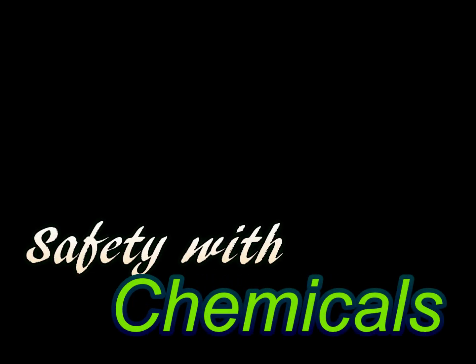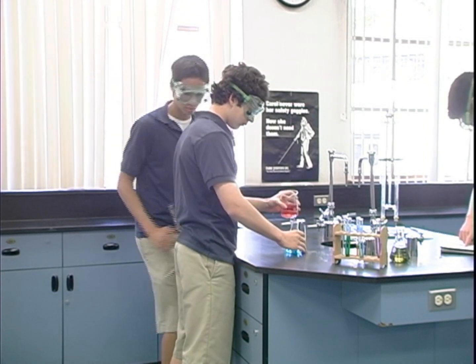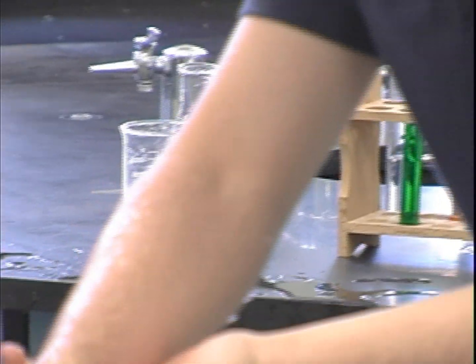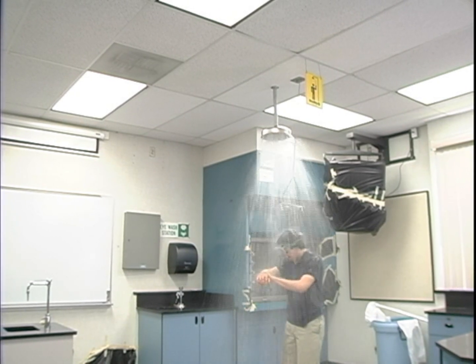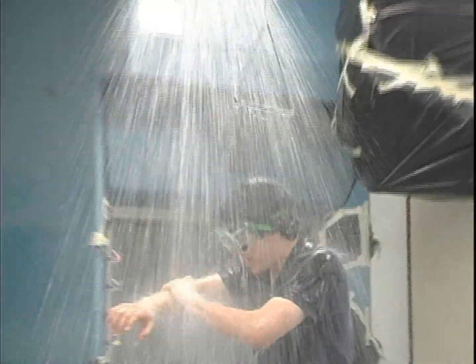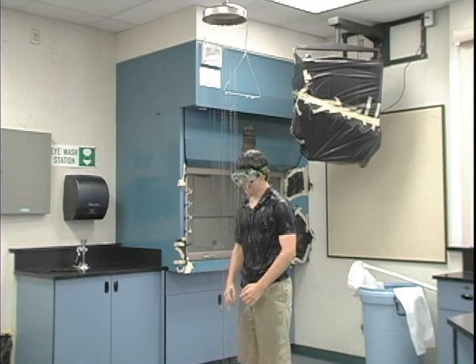As Carol unfortunately found out the hard way, chemicals are dangerous and should be handled cautiously. Never touch or directly smell unknown substances. Instead, waft and sniff cautiously. If Carol only knew that in the case of a burn from an acid or alkali, to immediately wash the affected area with plenty of running water. Her case could have been prevented.